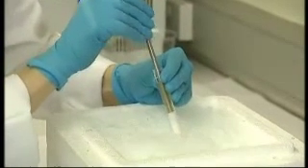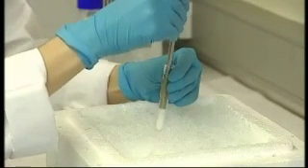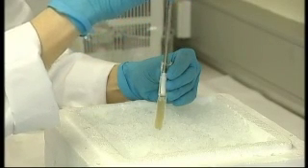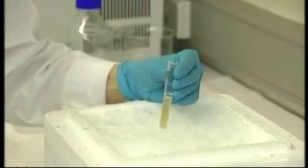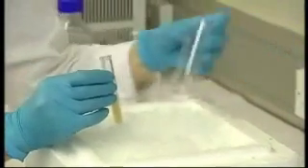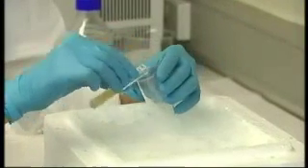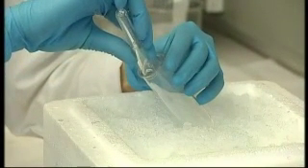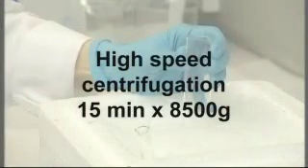Dilute the suspension with more isolating buffer and centrifuge again for 15 minutes at 8500g.